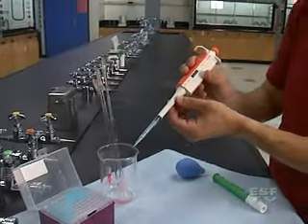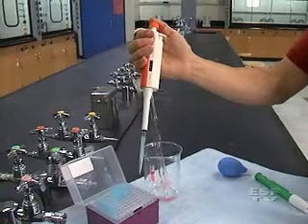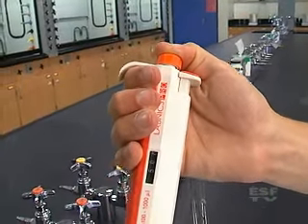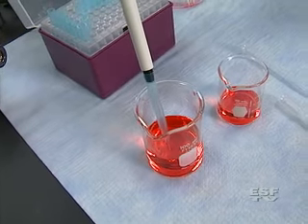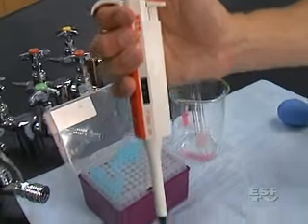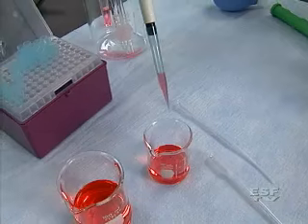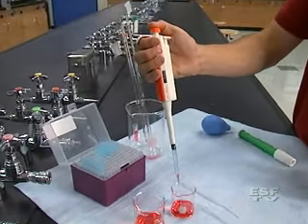I'm going to press down on the plunger. There is going to be one stop and you want to go to that first stop and just push down lightly. Then put your tip into the solution. As you put it in solution, you withdraw the knob slowly. You'll see that we've picked up exactly 500 microliters of solution. Now you can move this over to the beaker you want to transfer to. I'm going to push back down on that plunger and as I push down slowly it begins to dispense.